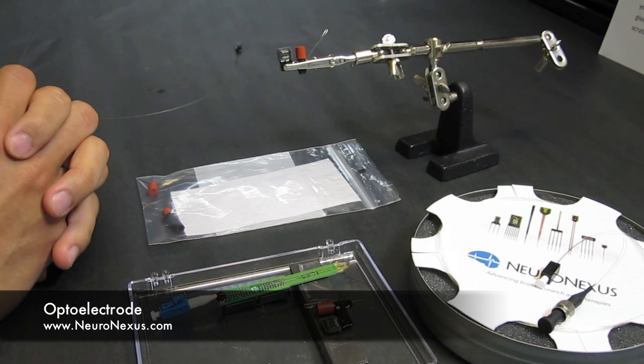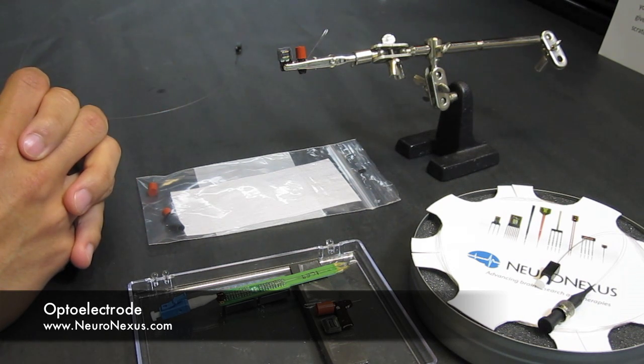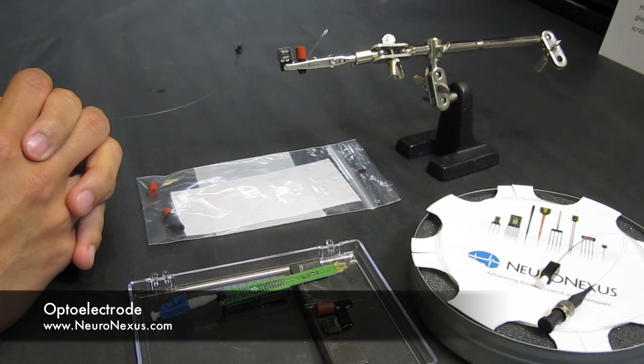Hey everyone, this is Jay from Neuronexus. We wanted to post a quick video describing a couple of important technical details about our optoelectrode products.